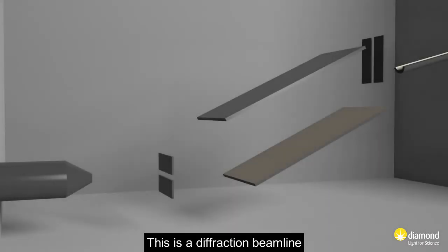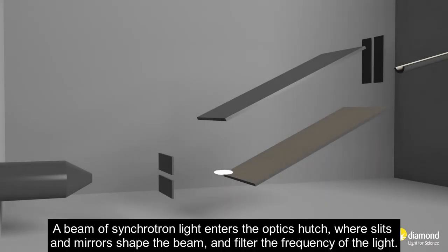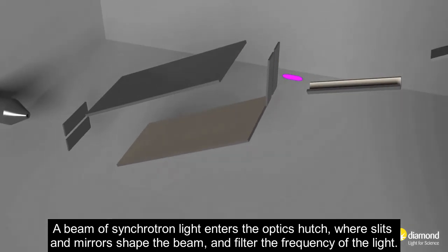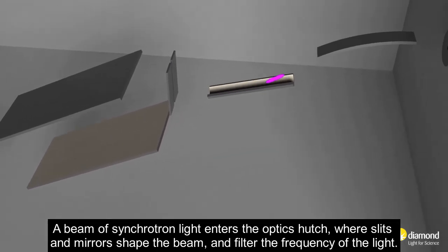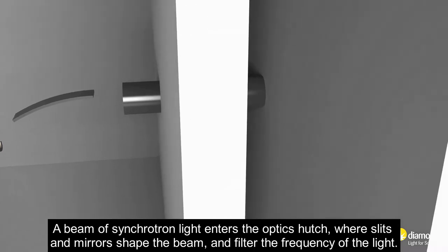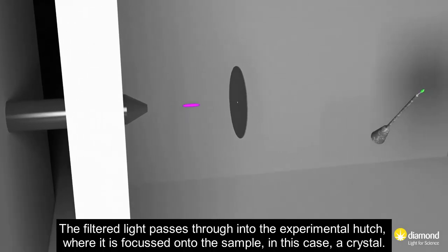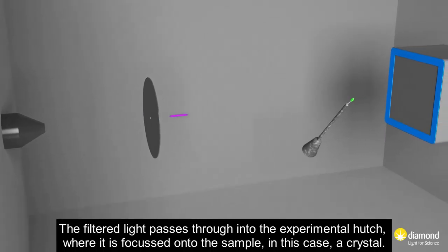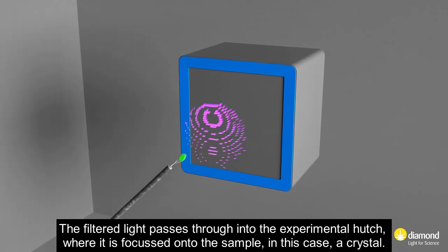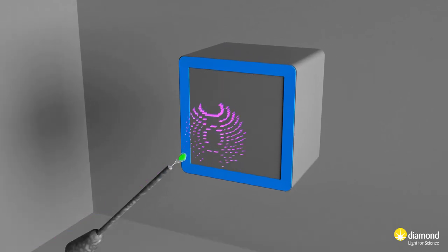This is a diffraction beamline. A beam of synchrotron light enters the optics hutch where slits and mirrors shape the beam and filter the frequency of the light. The filtered light passes through into the experimental hutch where it is focused onto the sample, in this case a crystal.